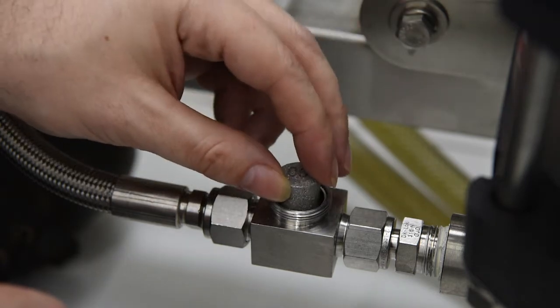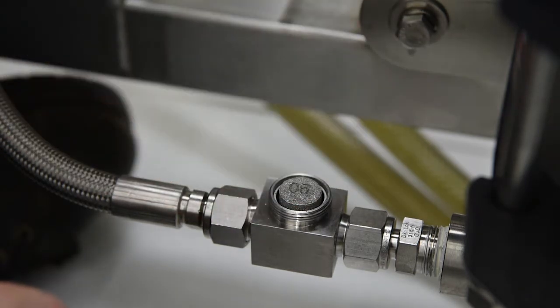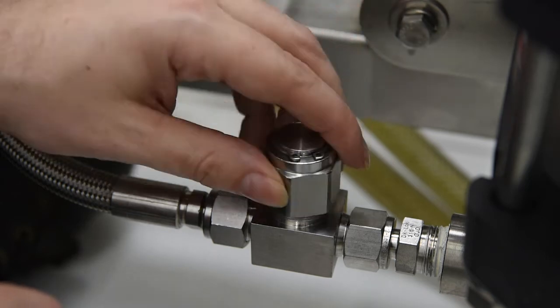Then, reinstall the filter. Install the o-ring and cap.